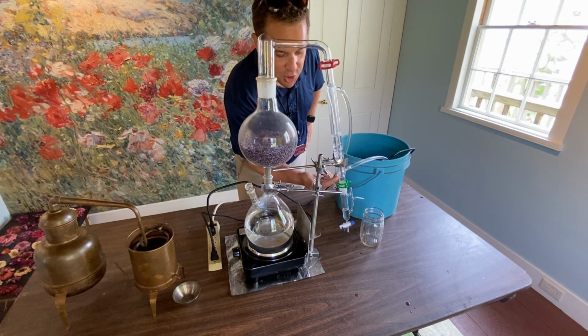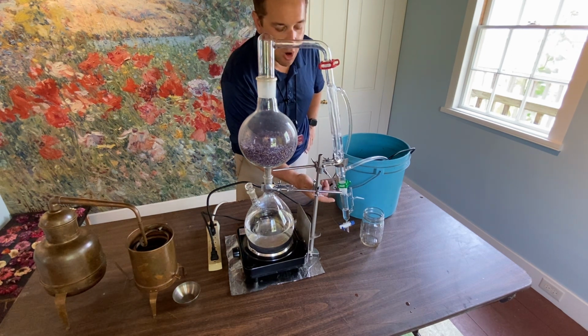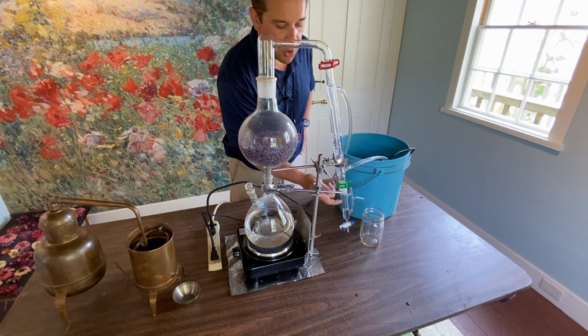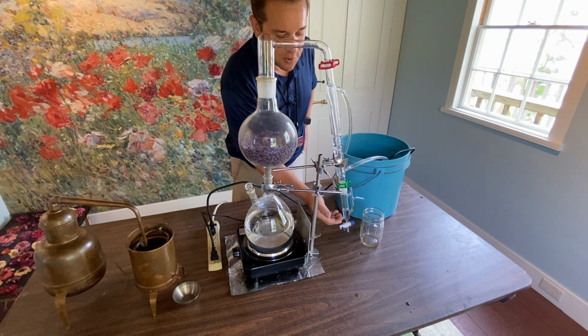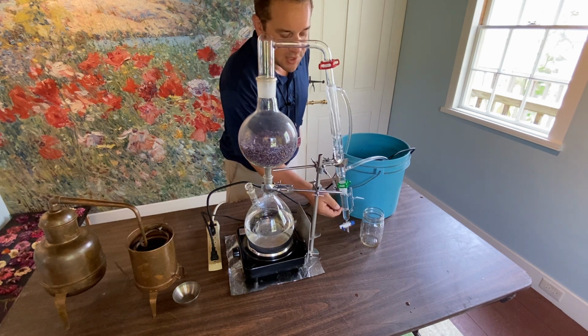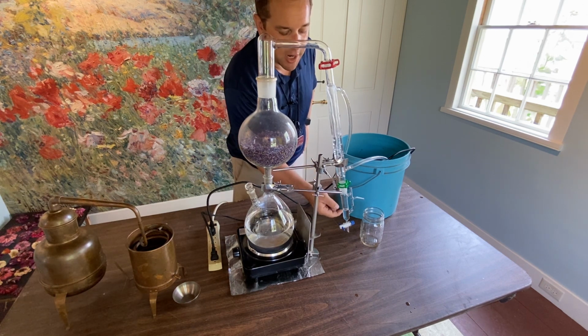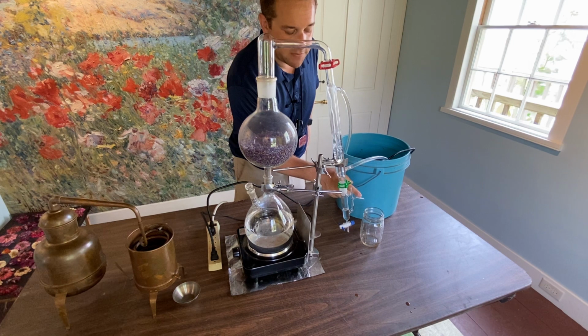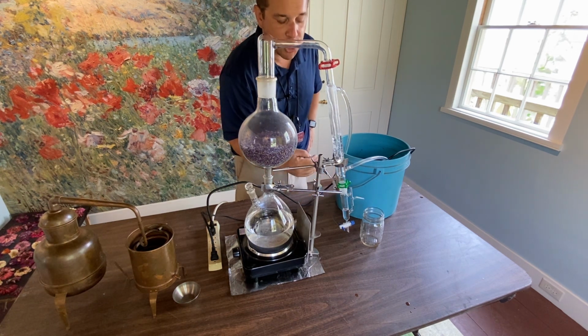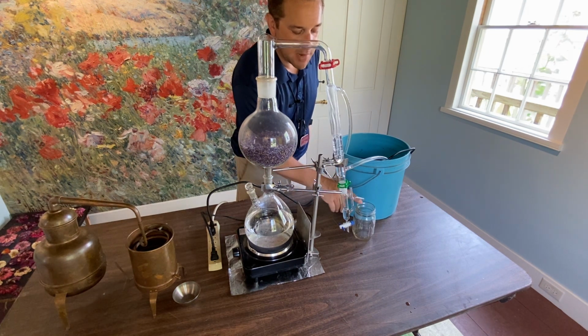Beyond the condenser, we have a part called the separator. Now the separator automatically separates oil from water. As you see, if you can see that, again, I'll give you a closer look soon, we have a little bit of distilled water already in the separator. And slowly but surely, we'll see oil accumulate right on the top. You see this valve on to the right side. Now, if any extra water accumulates beyond oil, it'll automatically go into this mason jar.